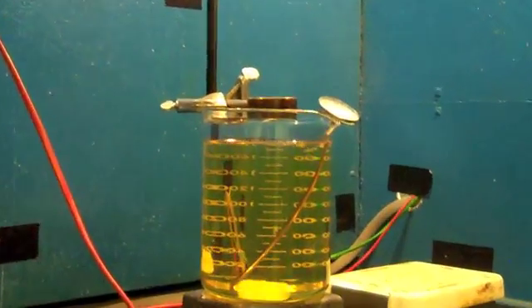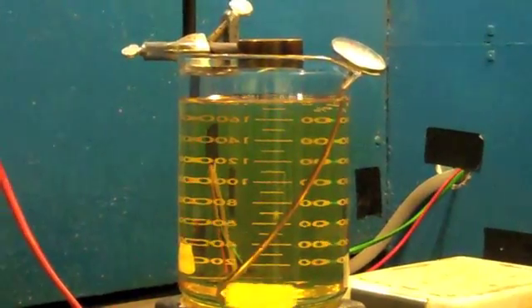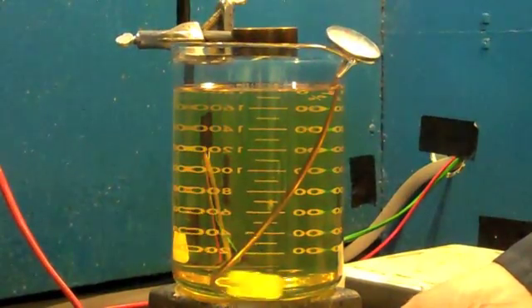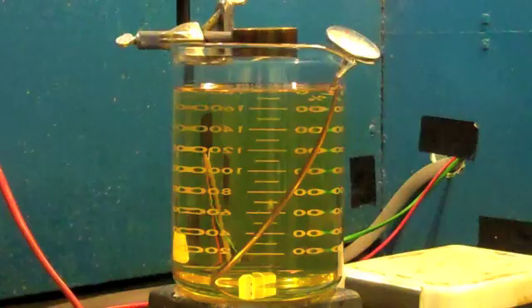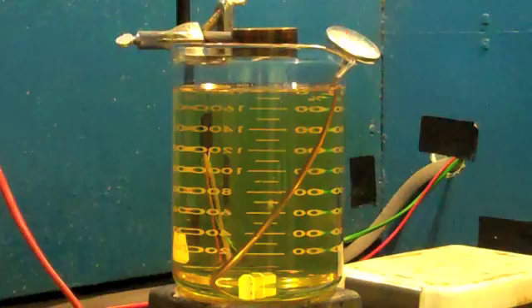We initially make sure the temperature is at the required 140 degrees. Once we are there, we turn off the agitation. For quench oils, the test is run without any agitation. It's a static test.